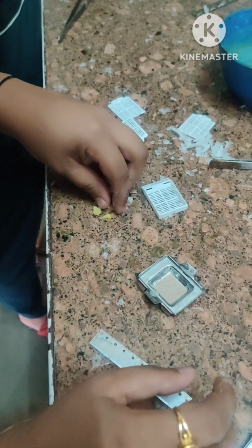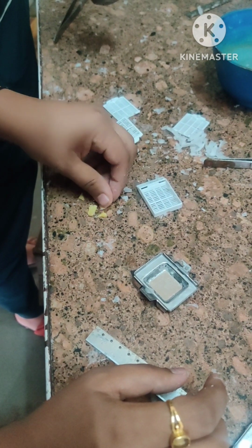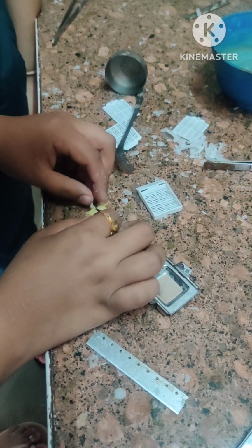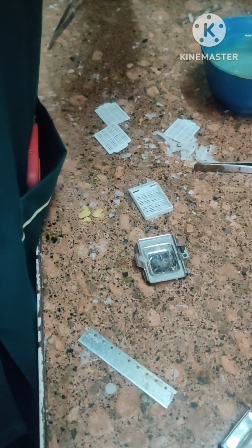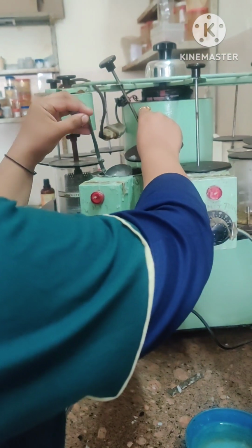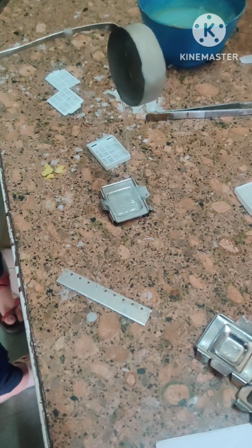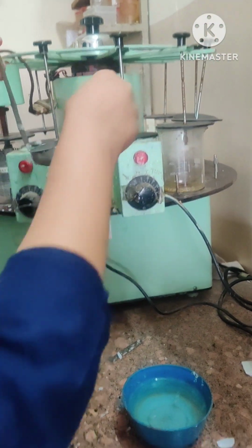We take the tissue together. There are multiple bits of tissues present now, so we gather them together. Now we take this tissue and put it in the block. Multiple bits. First we pour a melted wax in the block, which is purely melted, totally melted liquid paraffin wax, which is put in here. We fill the block till the edge.